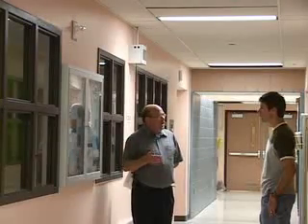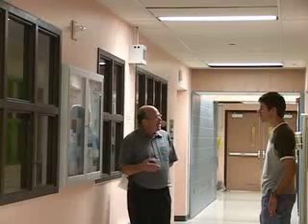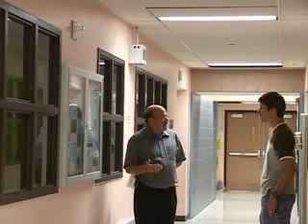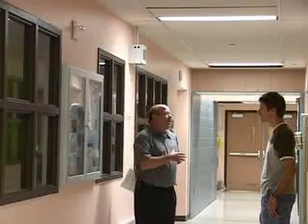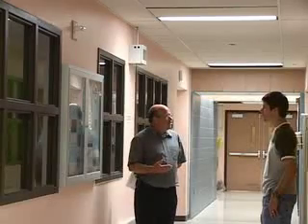If you remember from lab safety, threshold limit value, or TLV, is a time-weighted average, and that is a safe level that a worker can be exposed to during an 8-hour period. At half that value, we're evacuating you from the lab. We know there's a problem, and we've got to address it.